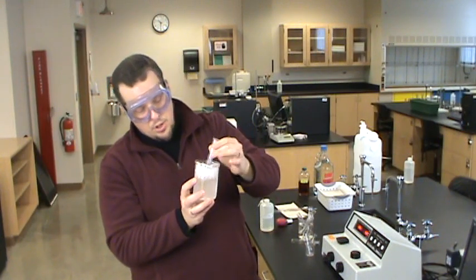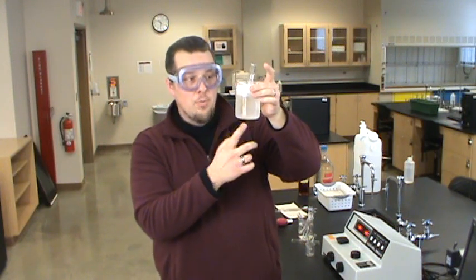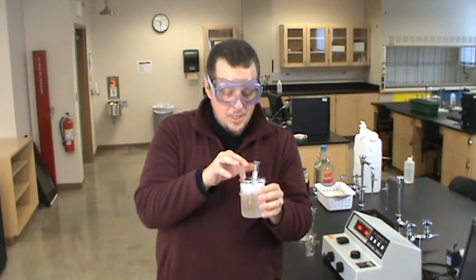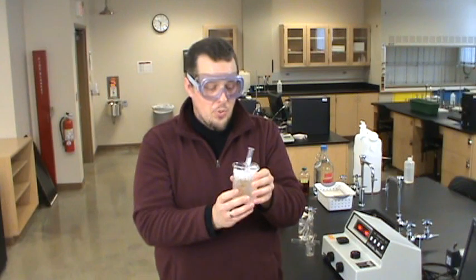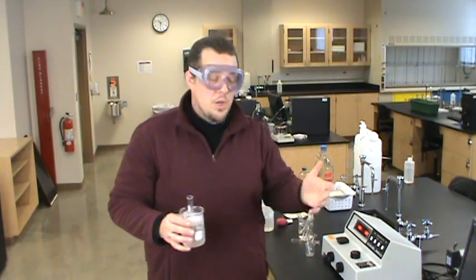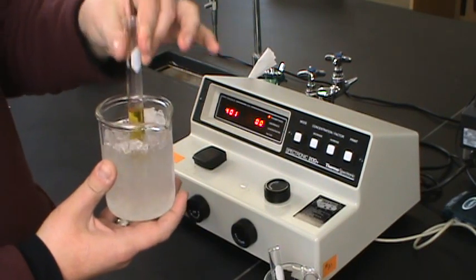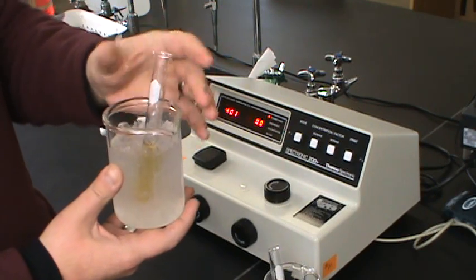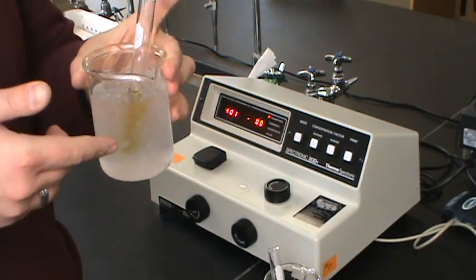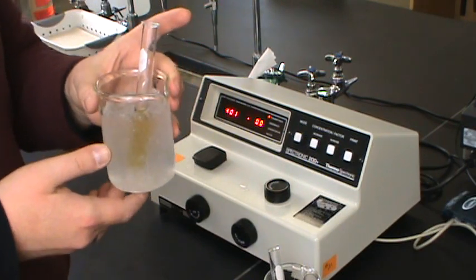Keep an eye on this reaction. You're going to set it aside. It's probably better if you don't let the test tube rest directly on the bottom of the beaker. Try to keep a little bit of ice under it. This is going to probably take the better part of an hour to an hour and a half to react. So set this aside, take a peek at it every once in a while. But now go ahead and do your other room temperature runs while you're waiting. Our cold run has been sitting in the ice bath for a little while. You see, it's still not really changing color all that much, but that's okay. Make sure you keep up on the ice bath to maintain zero degrees Celsius.